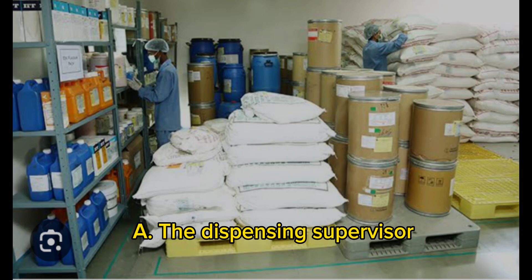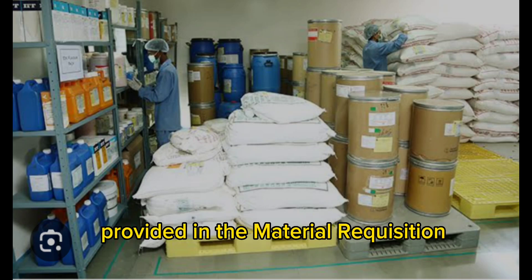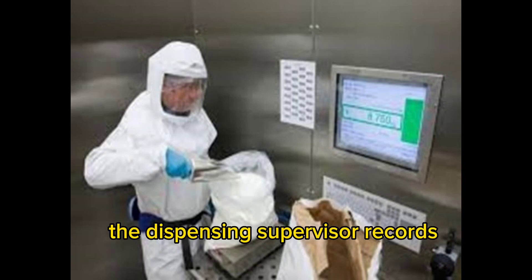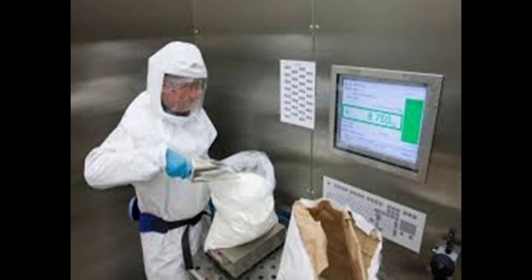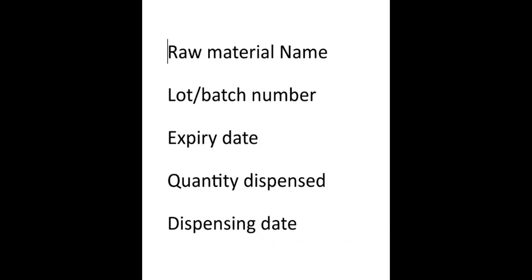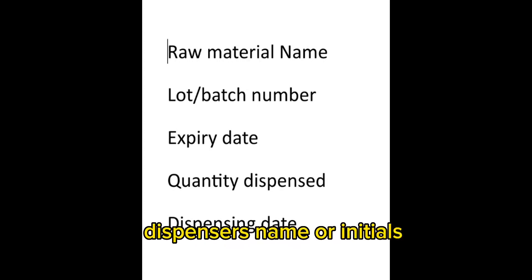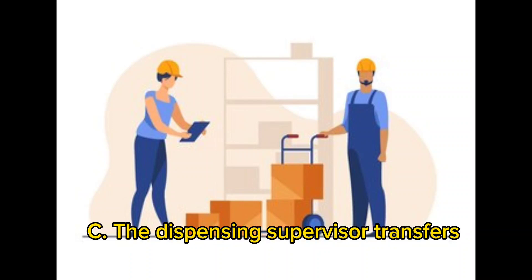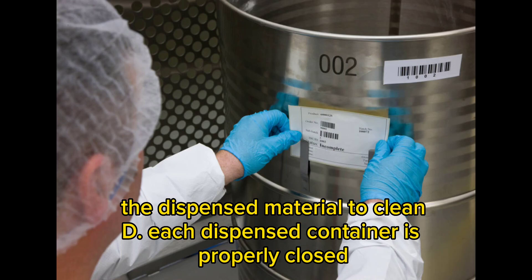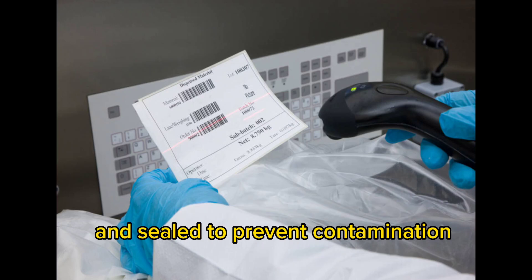Weighing and dispensing: The dispensing supervisor weighs the required quantity of each raw material according to the specifications provided in the material requisition. During weighing, the dispensing supervisor records the following information: raw material name, lot/batch number, expiry date, quantity dispensed, dispensing date, and dispenser's name or initials. The dispensed material is transferred to a clean, properly labeled container, and each dispensed container is properly closed and sealed to prevent contamination.